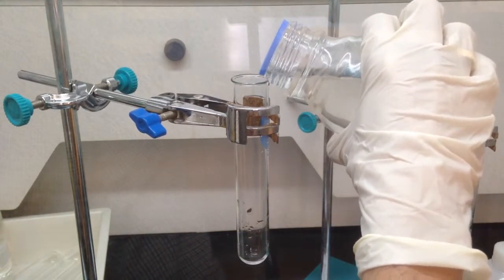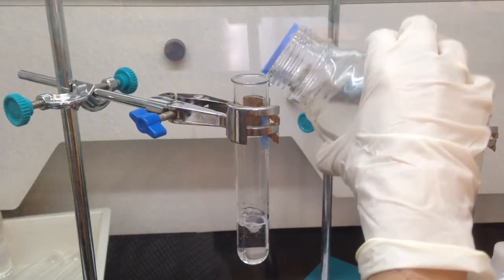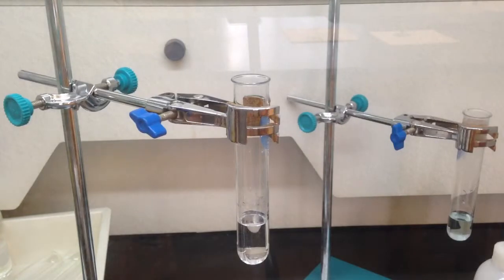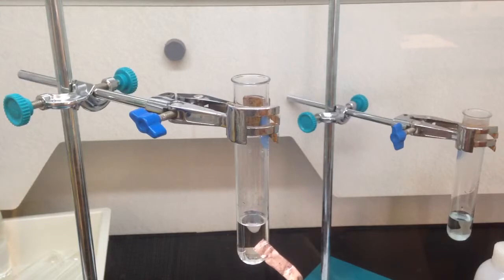The color of concentrated nitric acid is colorless. And we have copper metal here. As we have learned in the topic of acid and alkali, copper cannot react with most acids, except nitric acid. This time we have concentrated nitric acid and let's see what would happen.